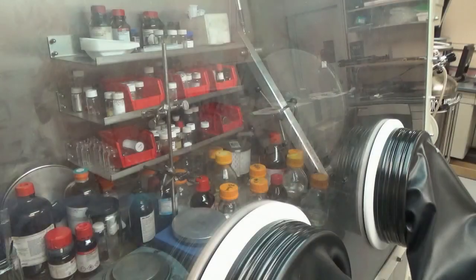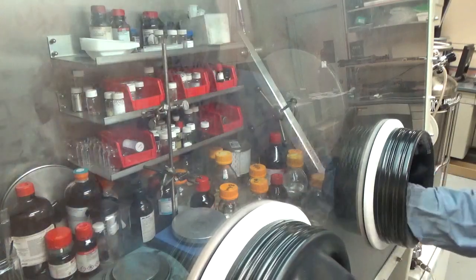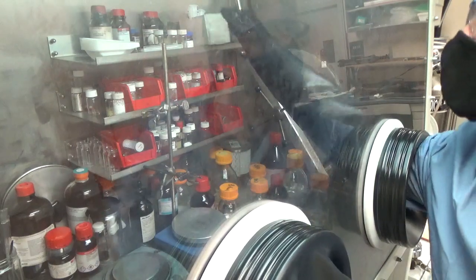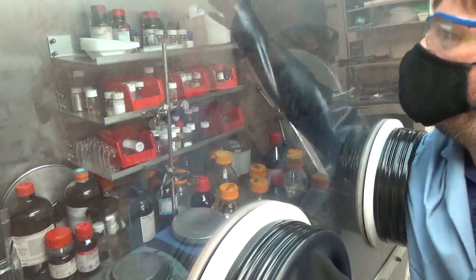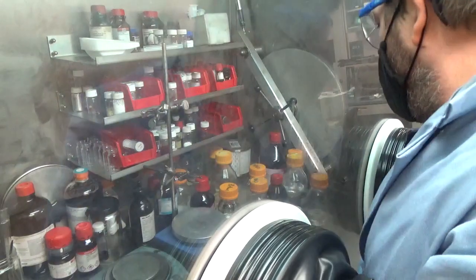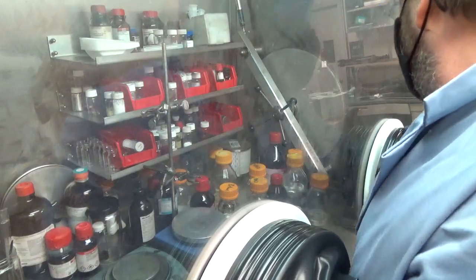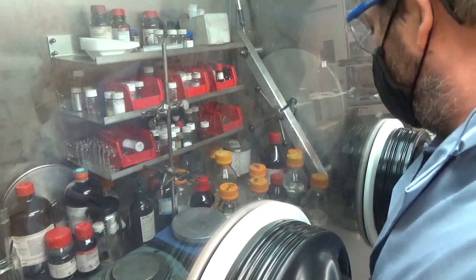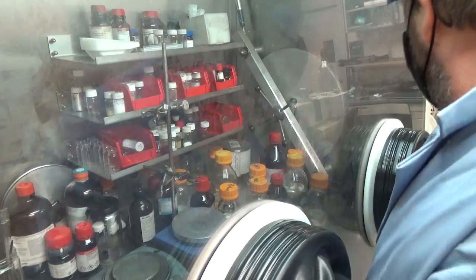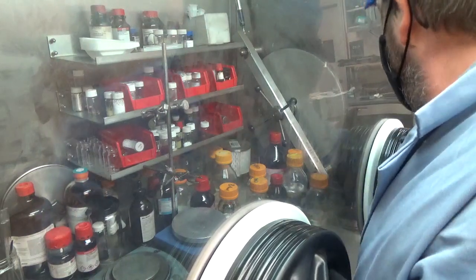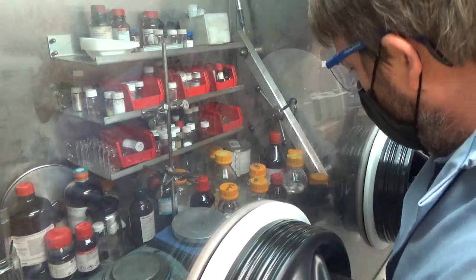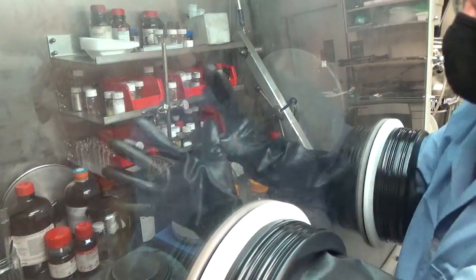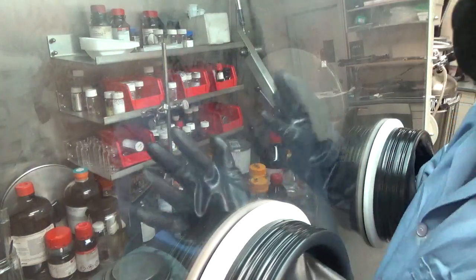The dots will actually even get brighter once we inject. Here you see me preparing the zinc solution - I'm using diethyl zinc. Again, everything is described in the paper. I'm also making a TMS sulfide solution, putting those in separate syringes. All of these precursors - TMS sulfide is air-sensitive, diethyl zinc is explosively air-sensitive.